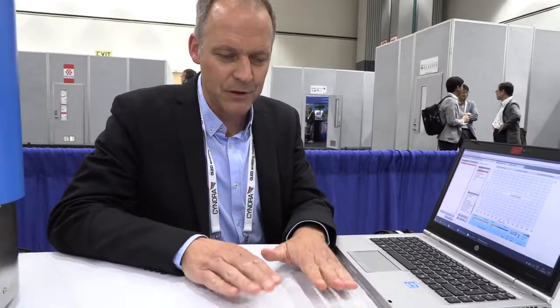Hello. Yes, my name is Beat Rustaller. I'm the founder of this company. We have targeted the OLED industry and research community worldwide, and this is our newest instrument that helps to improve OLED devices and OLED materials. We have started with simulation software in the past.